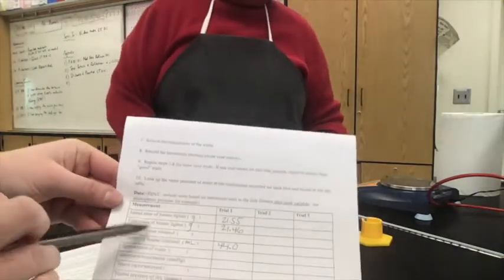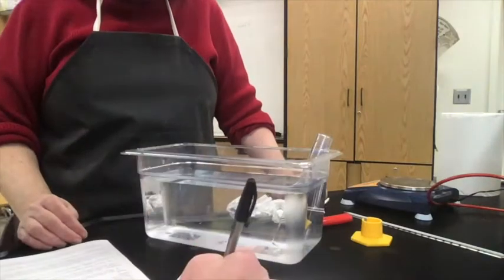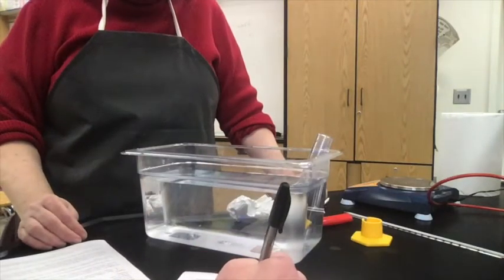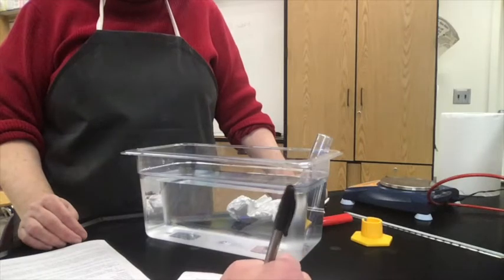So that's our final mass of the butane lighter in grams, 21.46, that we filled in for trial 1. And then to find the mass of the butane released, if we started with 21.55 grams and ended with 21.46 grams, then the mass of the butane that we collected is just the difference between the two. Which looks to be 0.09, right? 55, yes, 09. Which seems about right to me. 0.09 grams of butane collected.